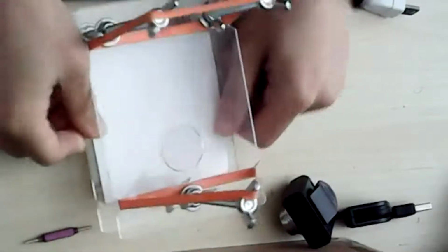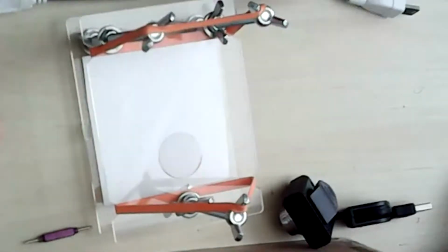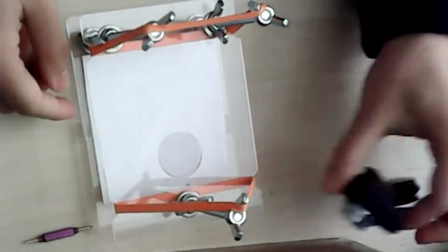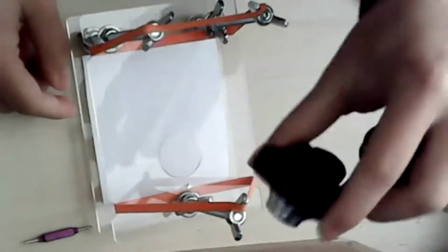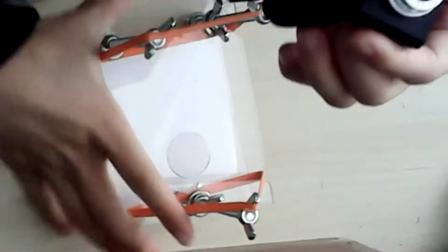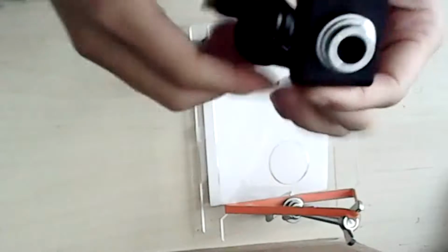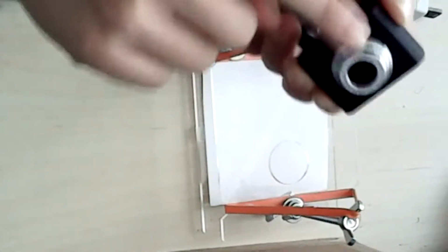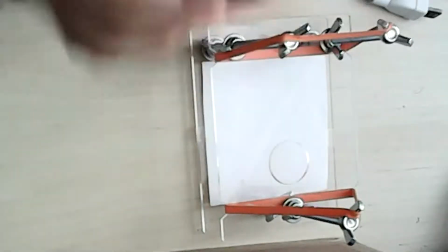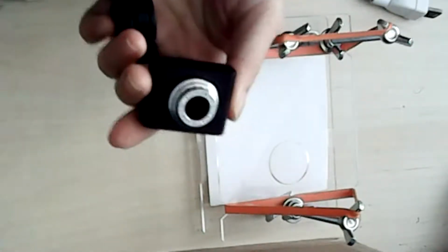So I've taped down my piece of paper, and I think we're pretty much set for the stage. So the next part is converting the webcam. This is just a regular webcam that you get with the kit. So what we need to do here is pretty simple. Basically we will need to open up the webcam and take out this top cover and then put it back together. That's what we're gonna do now.